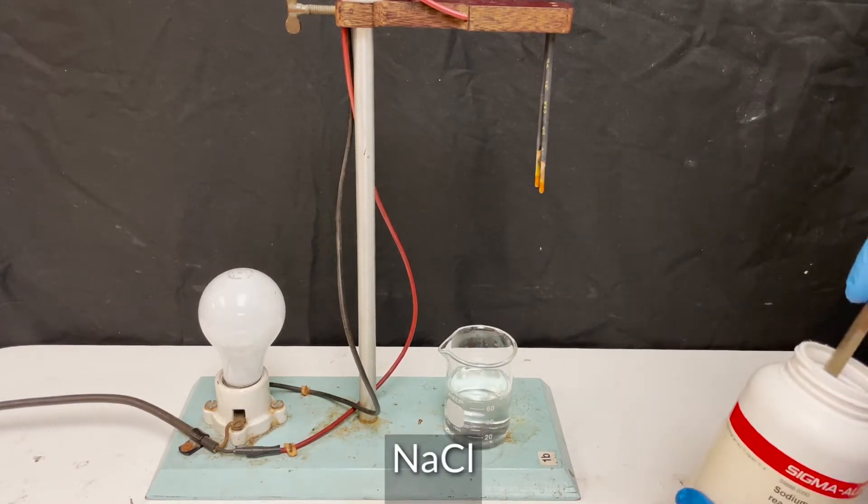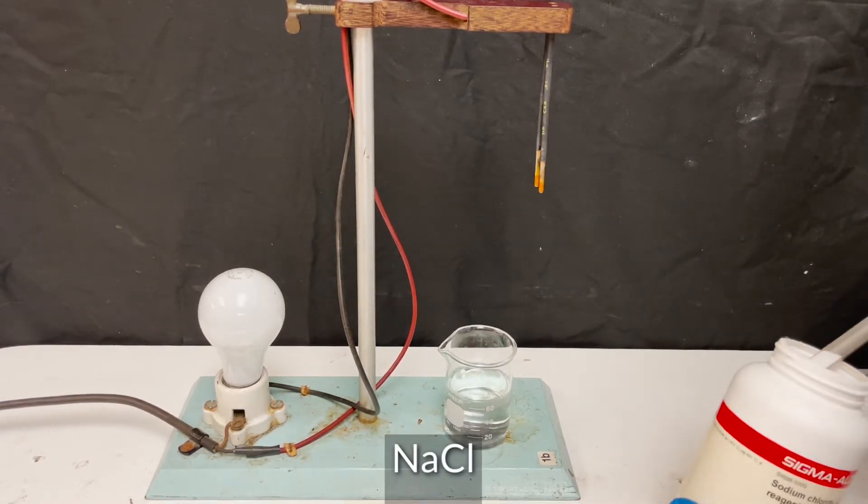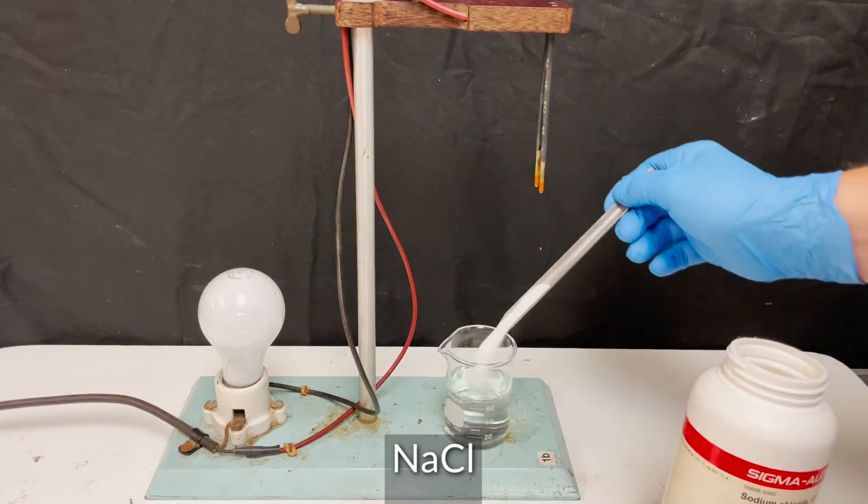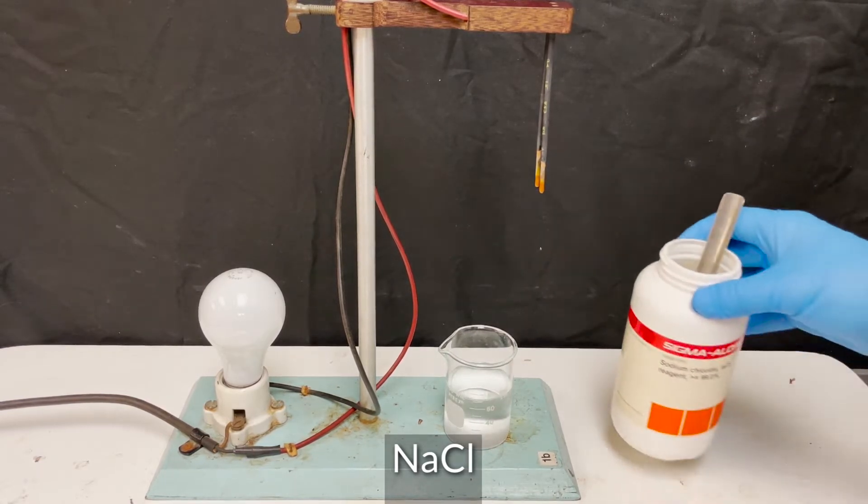For this video, I'm going to try and dissolve and then test the conductivity of solutions made from a variety of compounds, starting with sodium chloride.